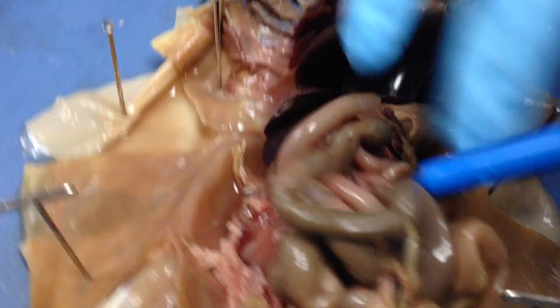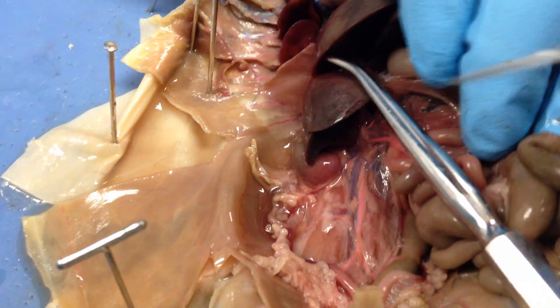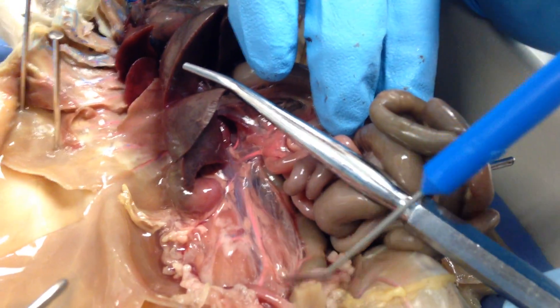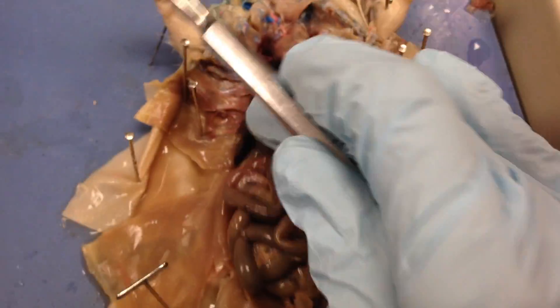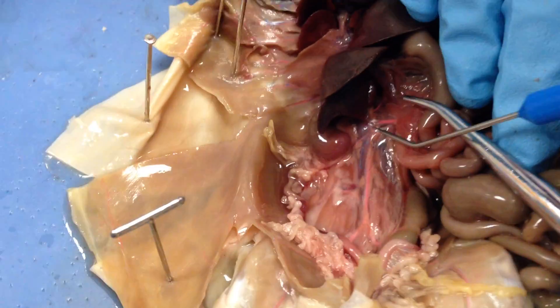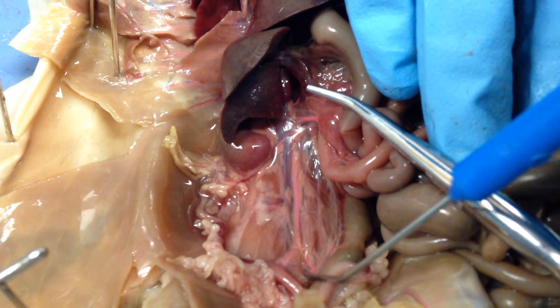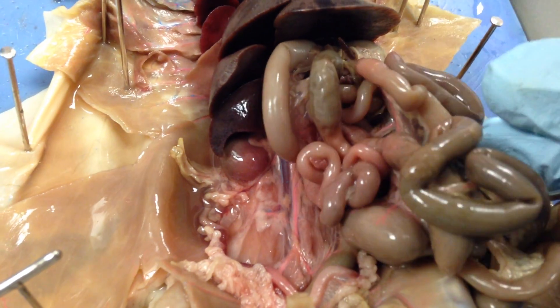That's all you really need to know. You can see down here you have more of the large arteries and veins that lead all the way down. These are your renal veins and arteries going down in this direction. And that should be good — that is for the female rat.